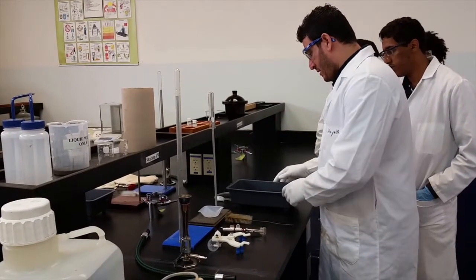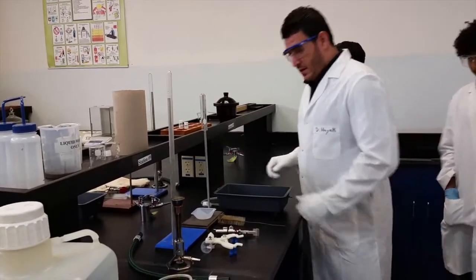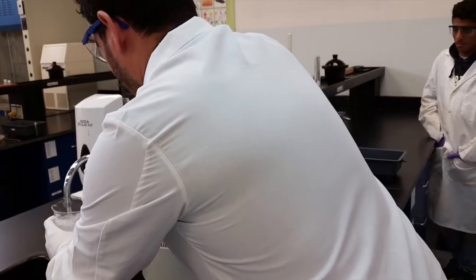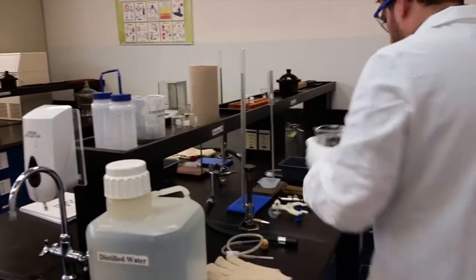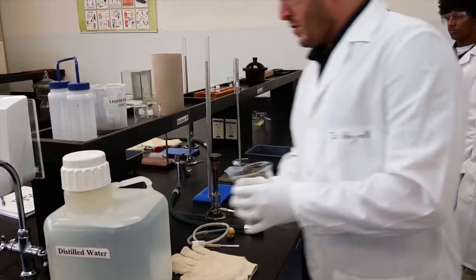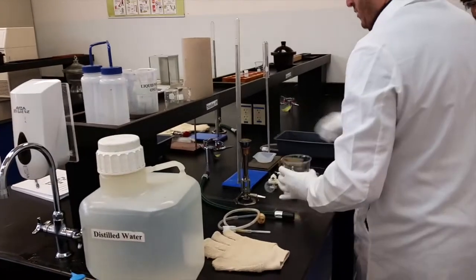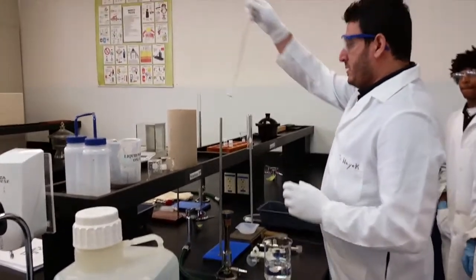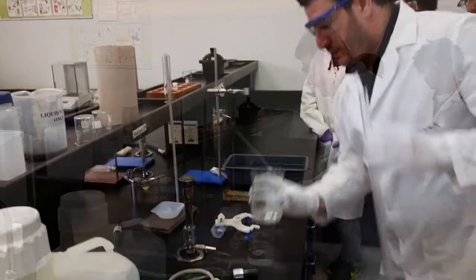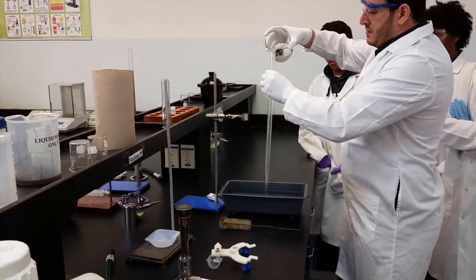So how are you going to do this? First, you start by filling the trough — make sure that it is closed. You will need roughly a liter and a half. You will also need some water to fill the tube. Now, you cannot just put it like that as with the hydrogen tube, because it might fall, so you need to use a stand. To fill the tube, you need to fill it gently so you don't leave any air bubbles inside.